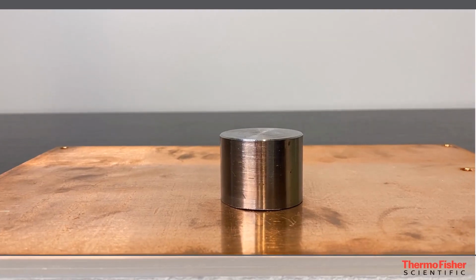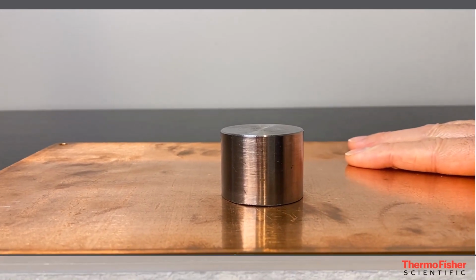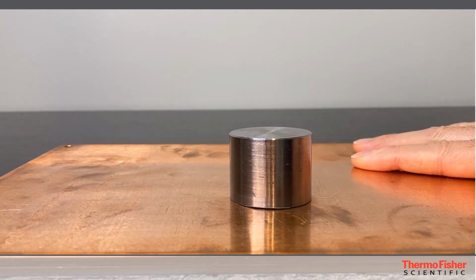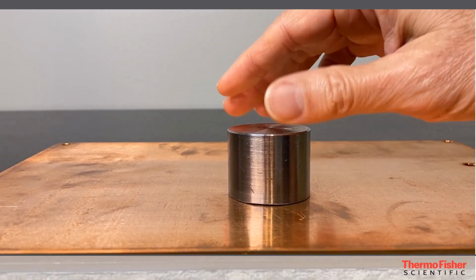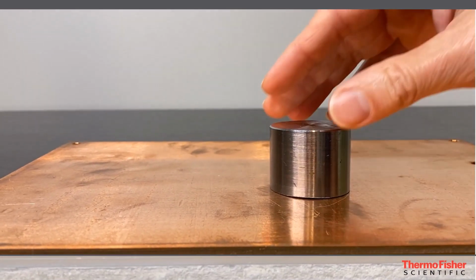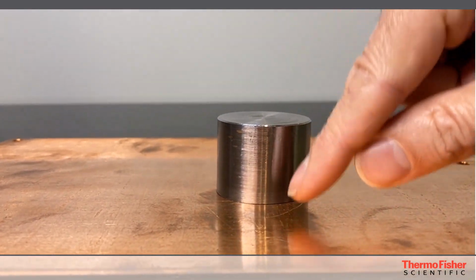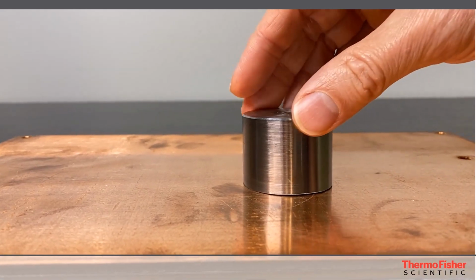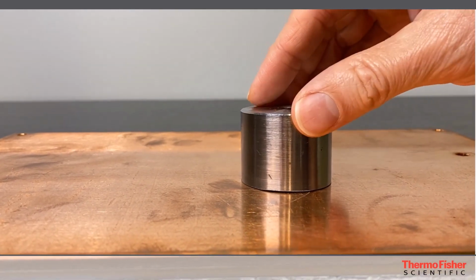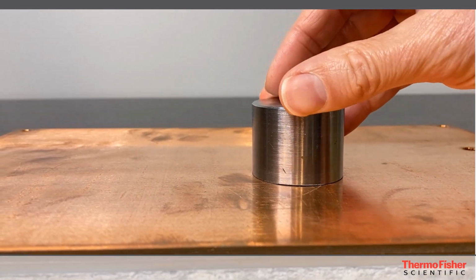Okay, so what we have here is a copper plate. We like to do this because this is a thing that we can use to cool down the sample after we've ground it. And what I'll do is I'll put the sample on flat. And if I rotate this around, you'll see that there's a side with no gap and then a side with a gap. And that's pretty clear what side has the gap. So we'll go to the deepest side and you can even kind of rock the sample back and forth.